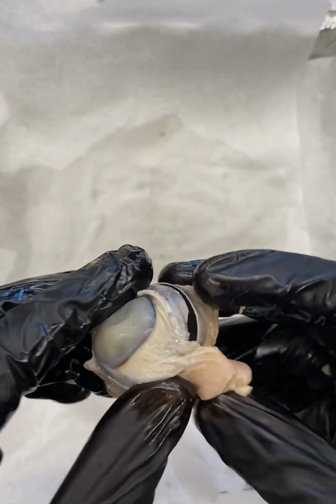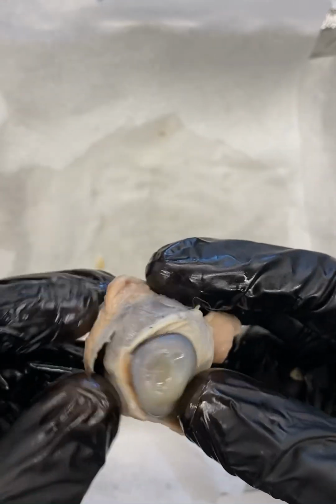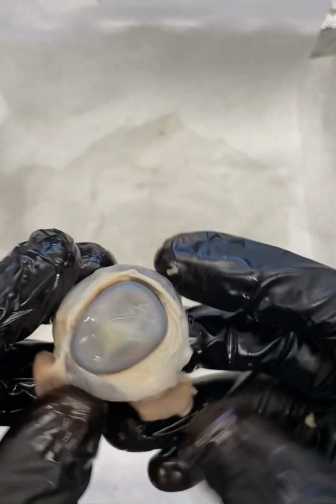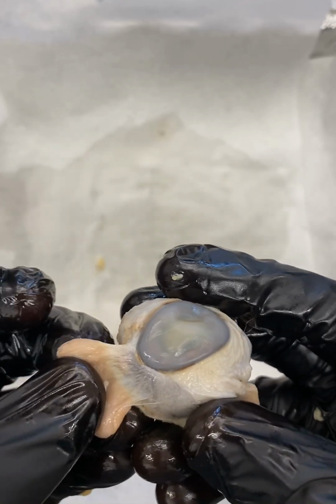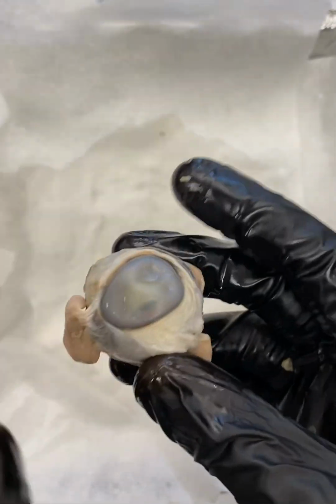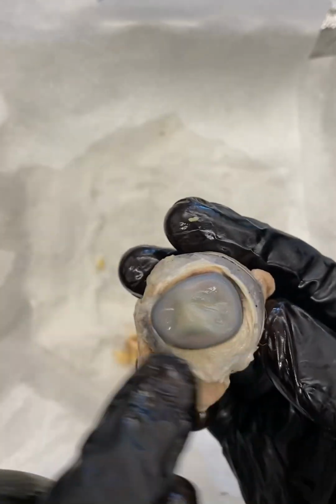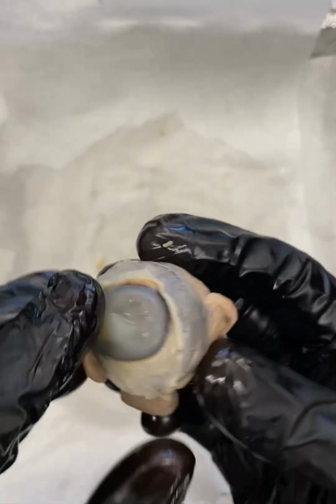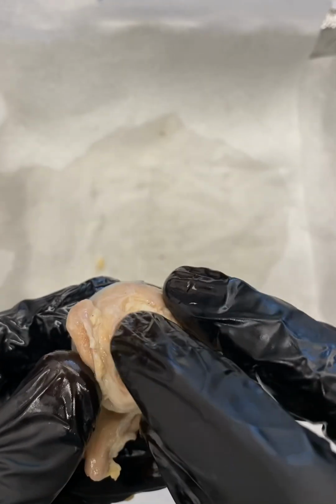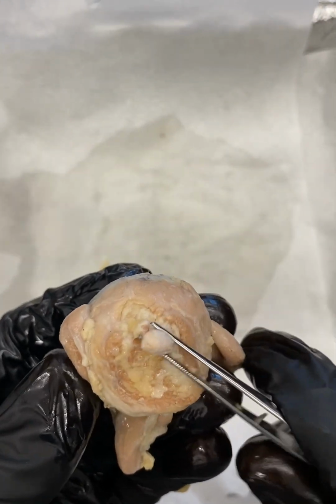This is going to be our continuation of our eye dissection. If you recall in the last video, if you haven't watched the last video, go and watch that first. Here we're looking at a sheep's eye, which again is a good model, a good representation of our human eye. We looked at most of the external anatomy of the eye, including some of the muscles. We talked about some of the layers, the sclera, the cornea, the pupil and iris. And then we ended by talking about our optic nerve right here.